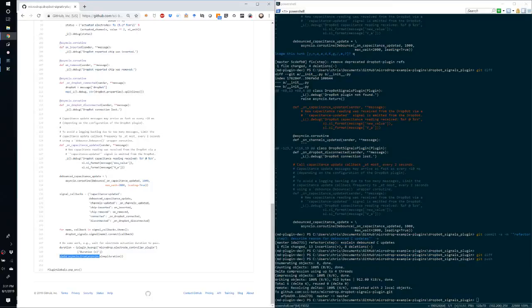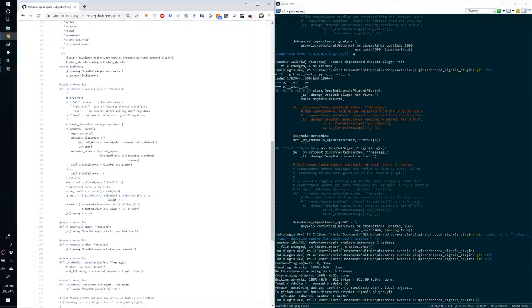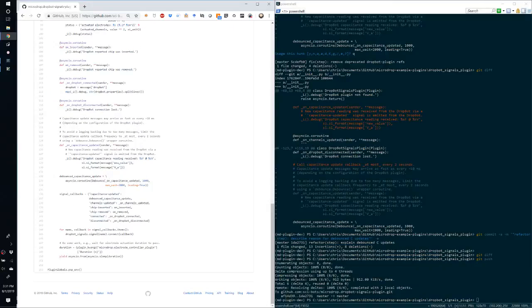And lastly, this is something that's specific to we're using async I/O capabilities, but we're currently stuck with Python 2.7 because MicroDrop is using GTK2 on Windows, for which we only have an implementation for Python 2.7. And so to get async I/O functionality, we're using the trollius package, which requires different syntax than Python 3's async I/O syntax.